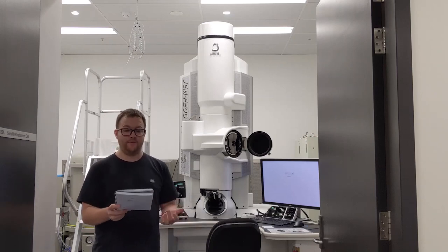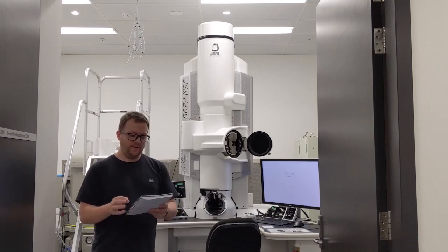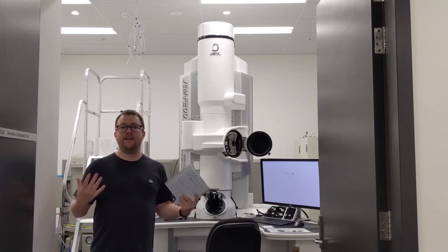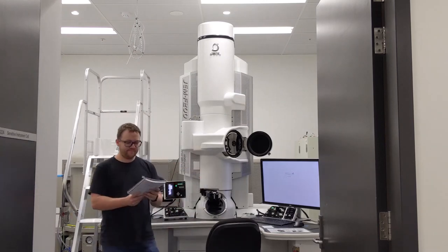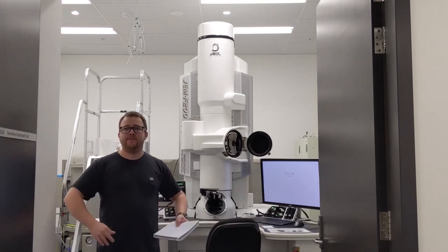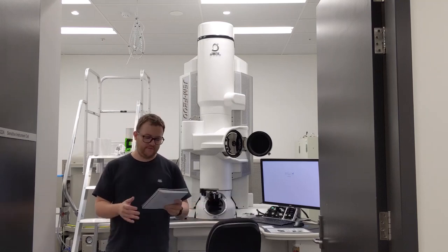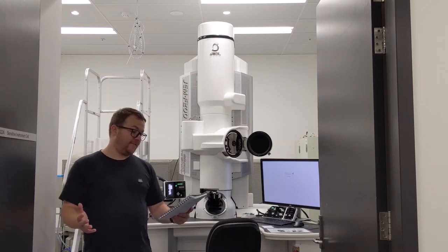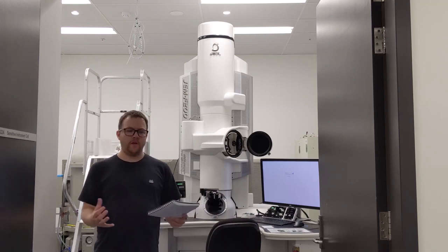This is the first point that we get to see the sample. However, this is a really, really small image, and so we need magnification lenses, which make up this bulk here. These can magnify that small image from 50 times to 2 million times magnification. At 2 million times magnification, we can start to see the atomic structure of the material we're looking at.